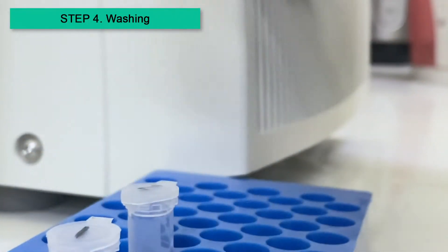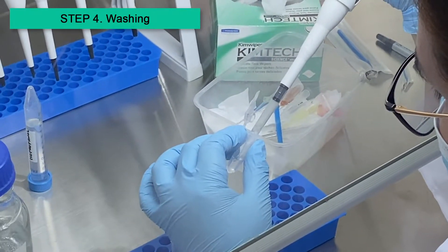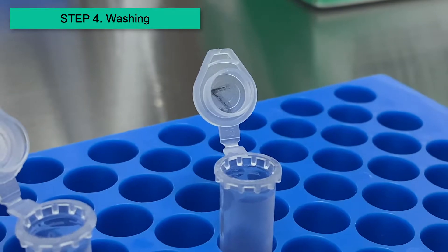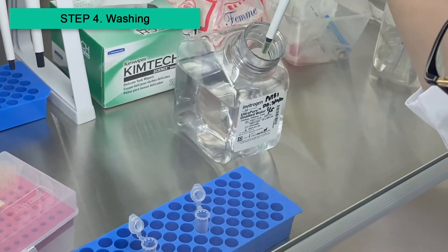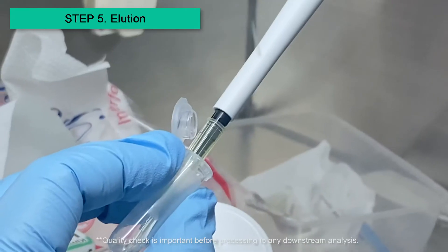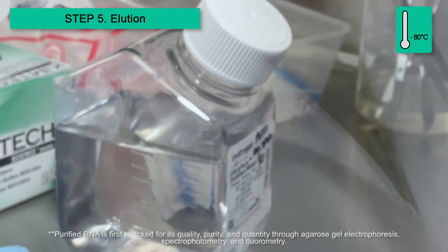The resulting RNA pellet is washed several times with ethanol to remove the remaining alcohol-soluble contaminants, and air dried to remove excess alcohol in the tube. Finally, the pellet is suspended in RNase-free water and can be stored at negative 80 degrees Celsius until cDNA synthesis.